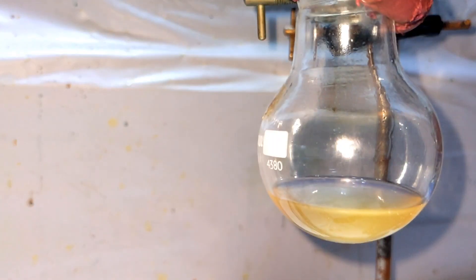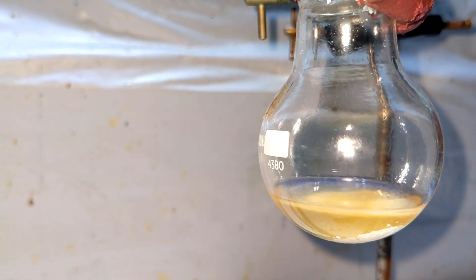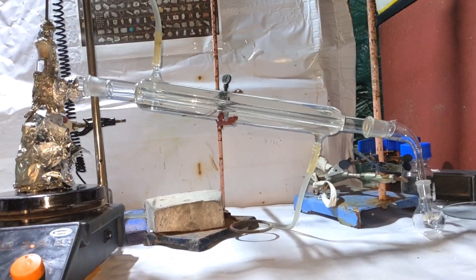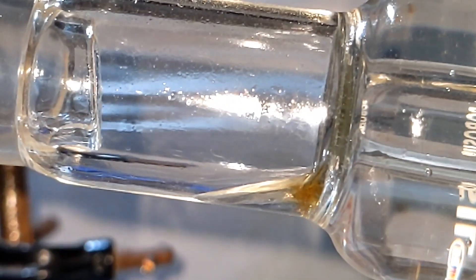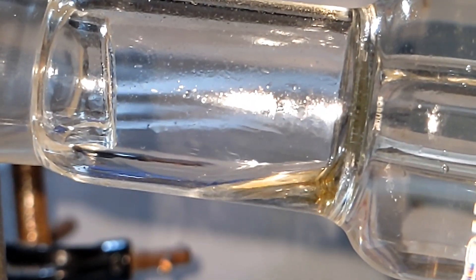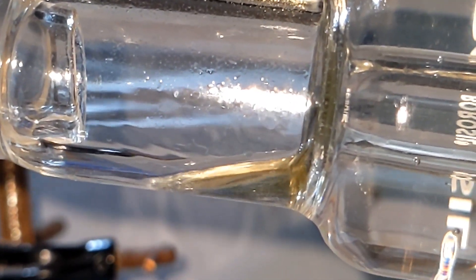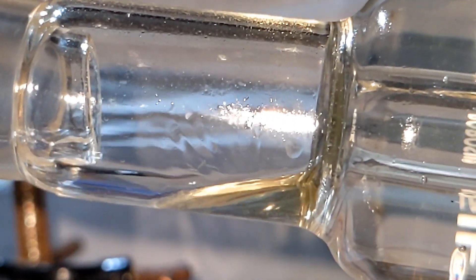The top layer was dispensed into a clean round-bottom flask and dried by adding anhydrous potassium carbonate. This treatment also removes any traces of adipic acid present in the solution. The flask was set up for a second distillation, temperature was raised to 131 degrees Celsius, and everything that distilled over between 129 and 131 degrees Celsius was collected.